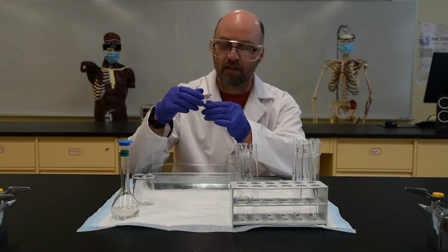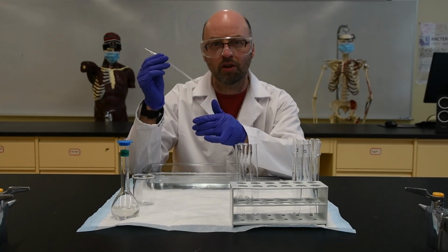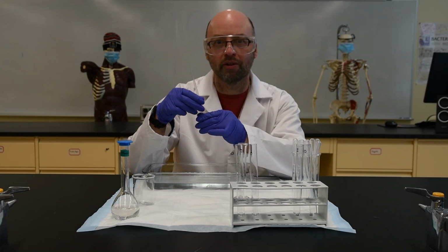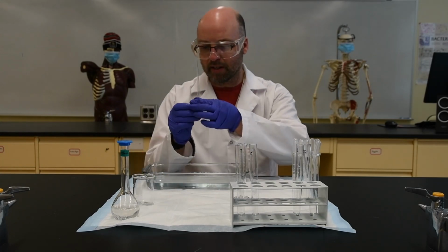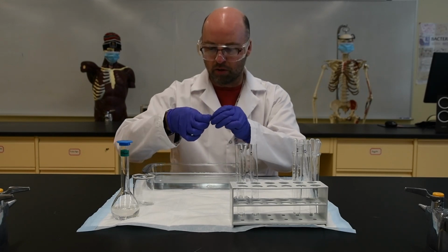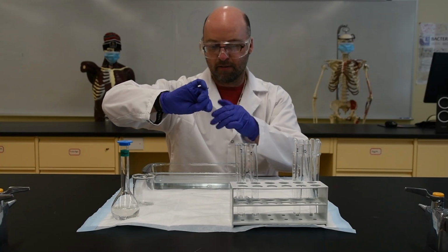So it's similar to a normal cell membrane, except obviously there's no ion channels here, there's no glucose transporters or anything like that. So basically what I'm going to do is tie a nice knot in there, nice and tight.